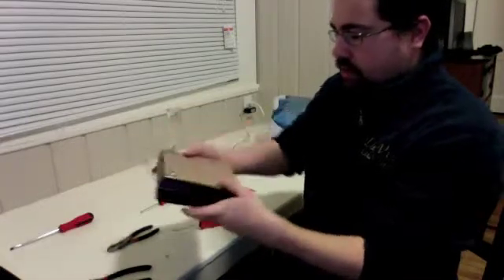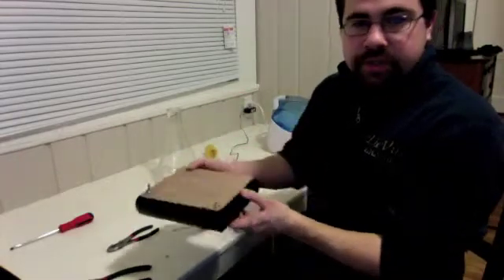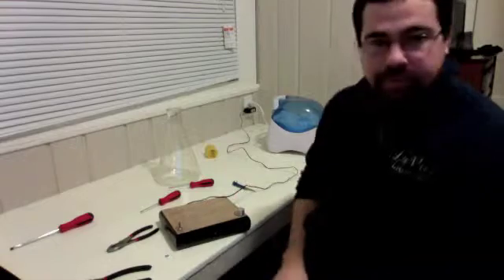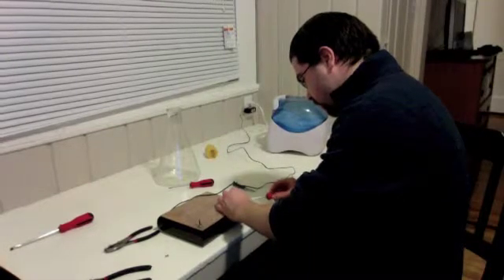Did you ever explain where the magnet was? Yeah, I did. So, then you have your surface. This is going to be like so. Then this guy just goes right on the top there. Demonstrate it in its full form, man. I will in just a second.